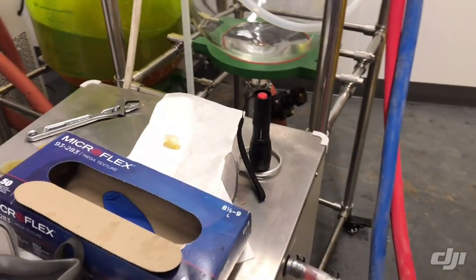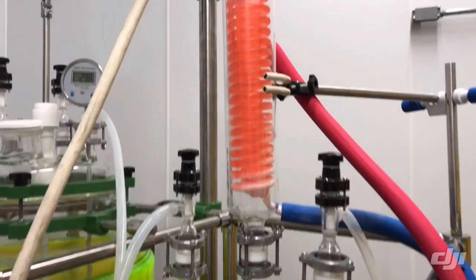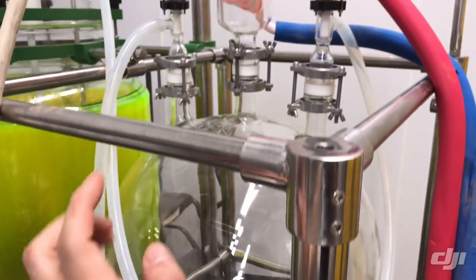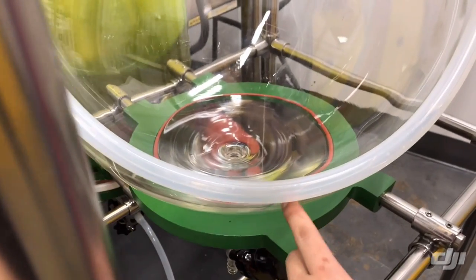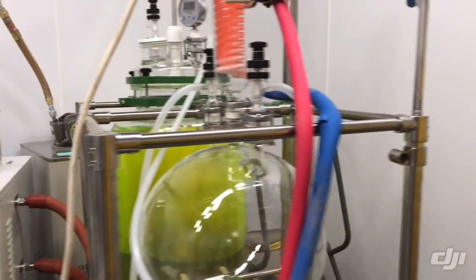On the right side, this is just a chiller. The chiller makes sure that all the pentane vapor that evaporates from this chamber gets caught and condensed into the receiver. This is very important — we do not want any pentane to escape into the atmosphere. The fire department would not like that, and this is the safe way to do it.